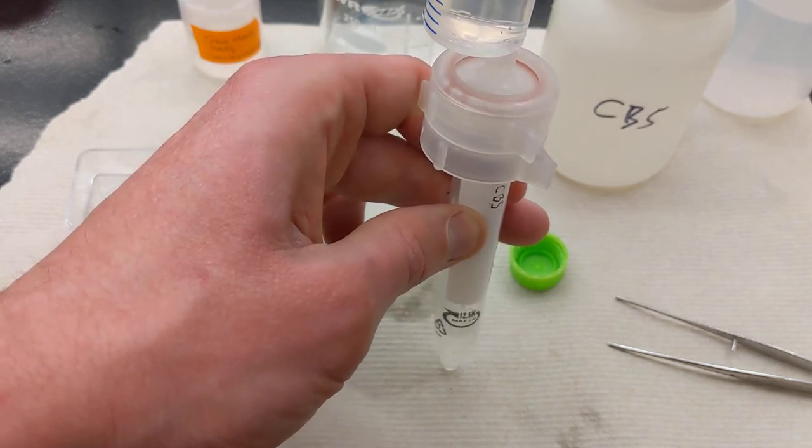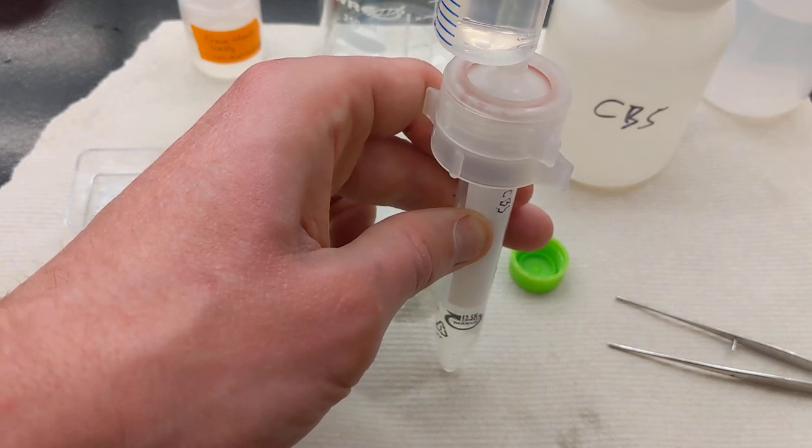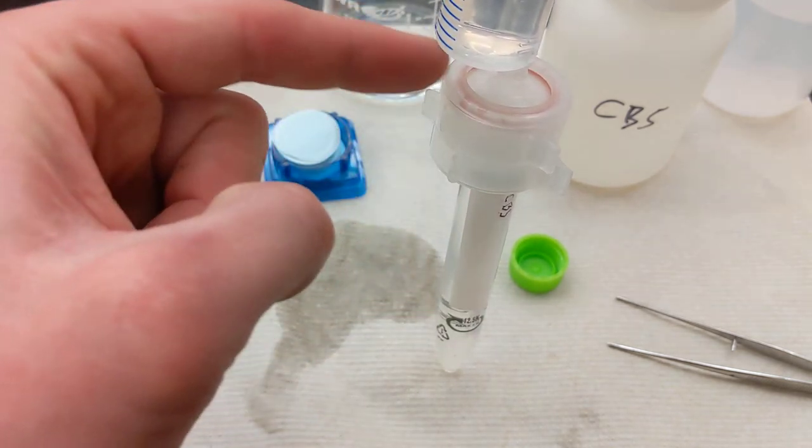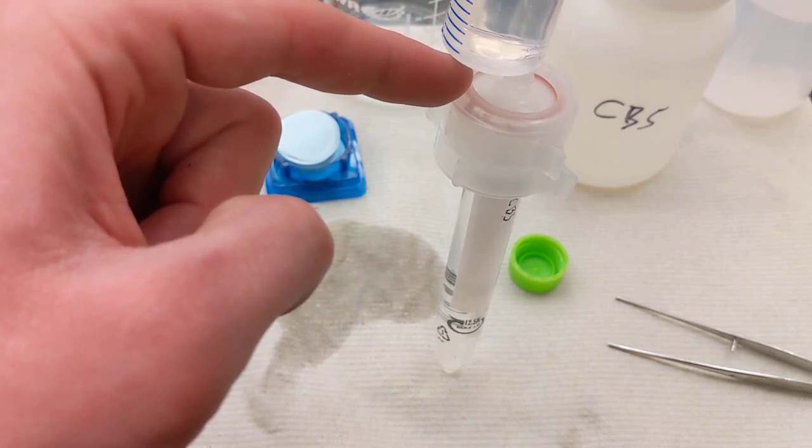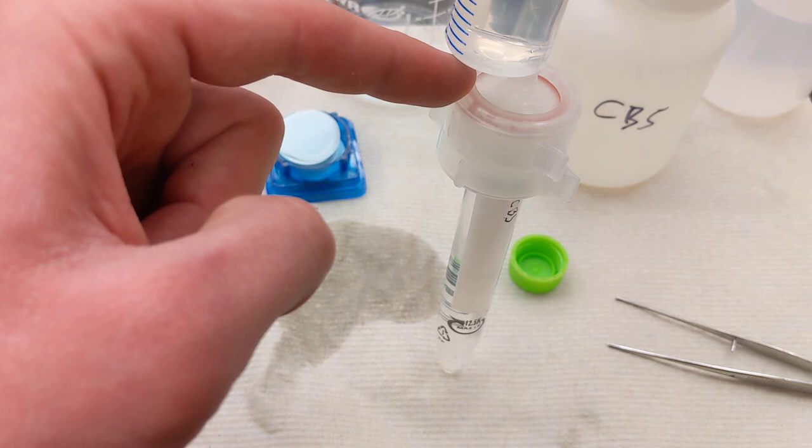Notice I'm filling. I'm not getting much leaking at the top. If you get a lot of leaking up here at this part, that means you probably didn't tighten it enough, or you don't have your notches aligned, and so there's a small step.